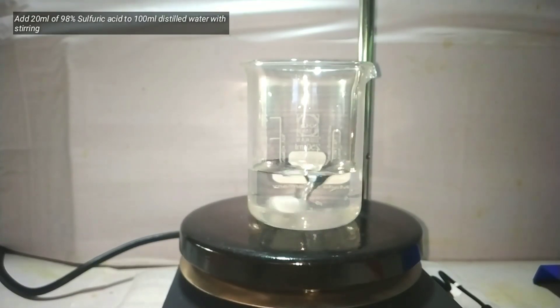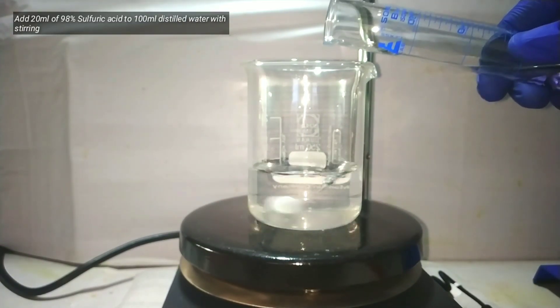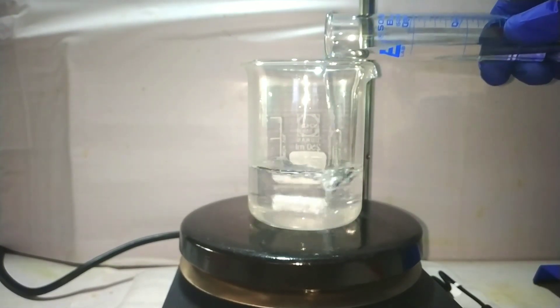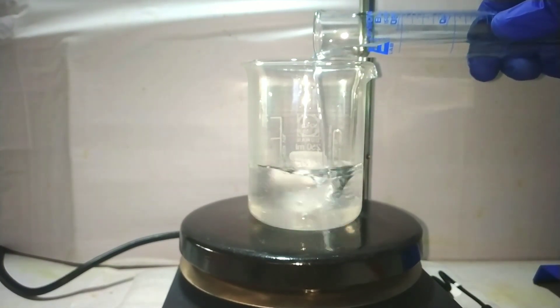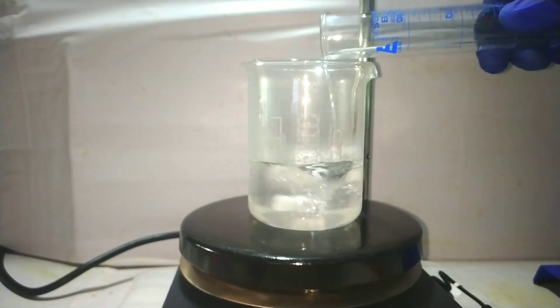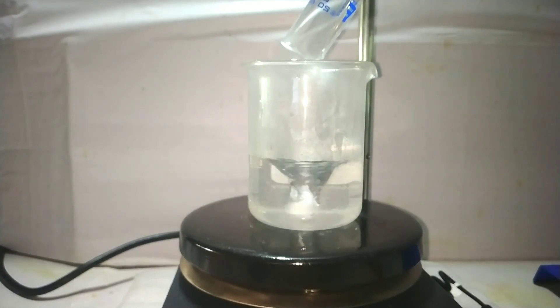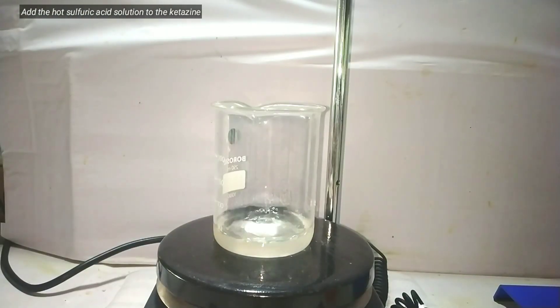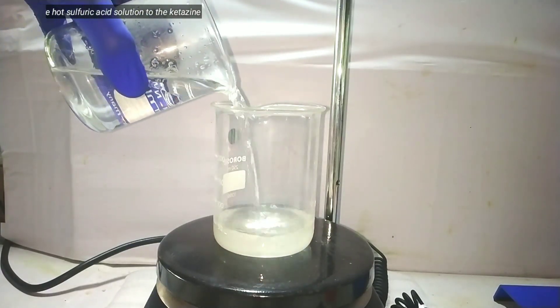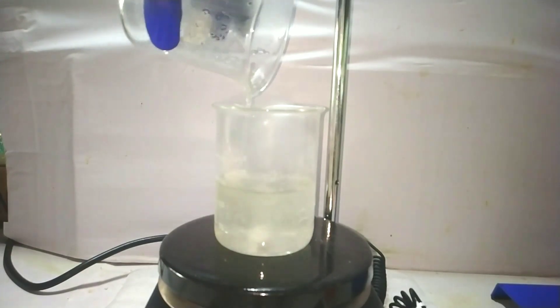Now, we make a dilute sulfuric acid solution by dissolving 20 ml of concentrated 98% sulfuric acid into 100 ml of distilled water with stirring. The ketazine was taken from the separatory funnel and placed into a beaker, and the hot sulfuric acid is added into the ketazine all at once with continued stirring.